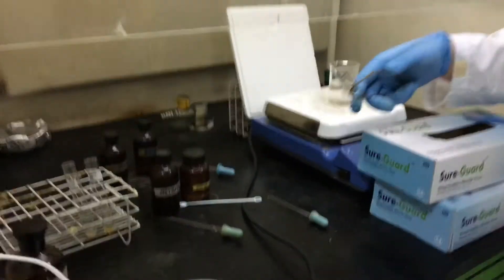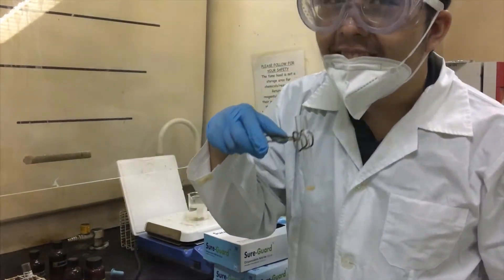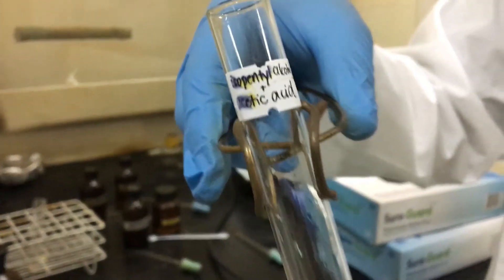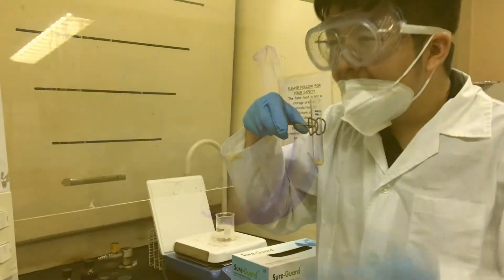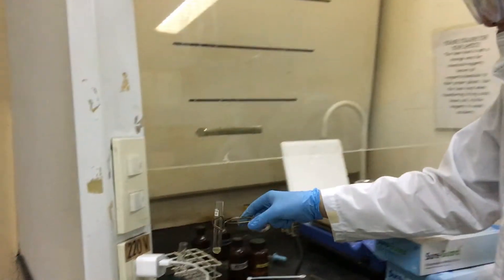After removing the tubes from heat, we gently smell the vapors produced. The product of the combination of salicylic acid and methanol smells minty, almost like efficascent oil. And the product of the combination of acetic acid and isopentyl alcohol smells fruity, like bananas.